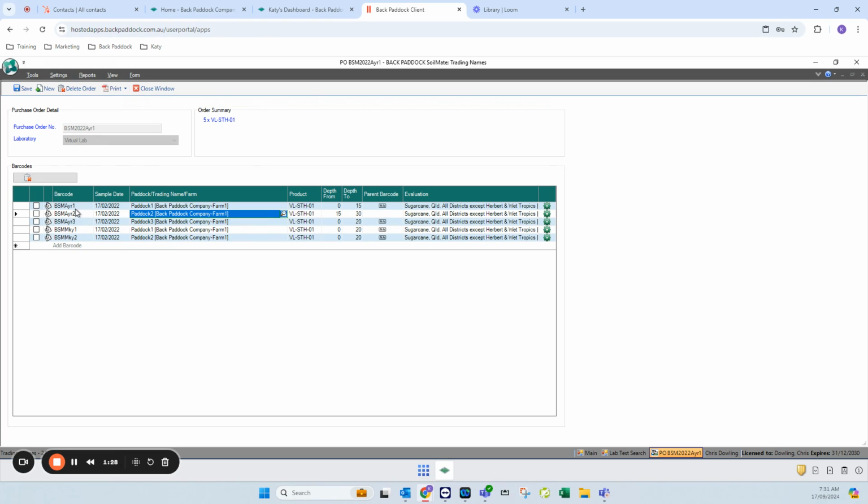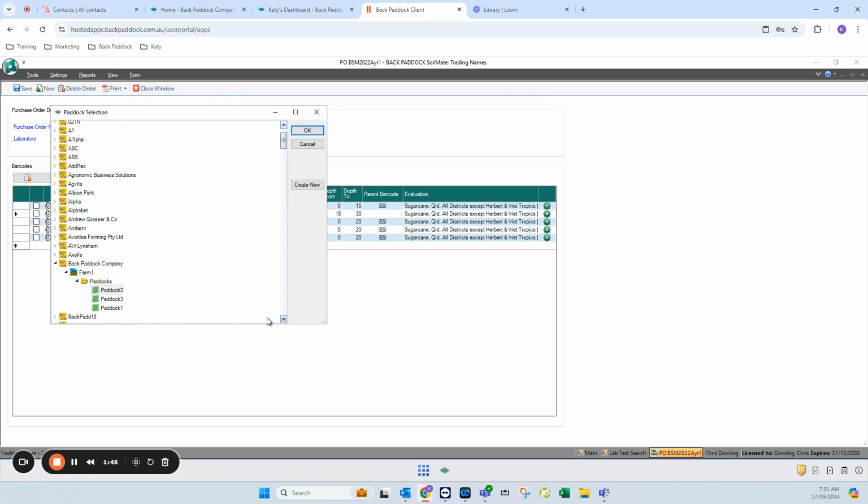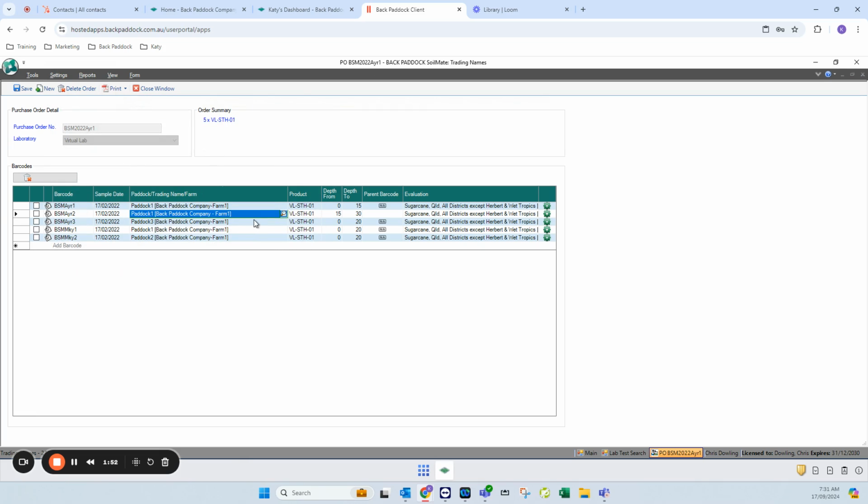So because I want Air 1 and Air 2 to be a profile, they both need to be assigned to the same paddock. So now we're going to go with scenario 2 and reassign this barcode, Air 2, to the same paddock as above. So I'm going to click in this field here, I'm going to click my magnifying glass, and I'm going to assign this one to paddock 1 instead of paddock 2 and click OK. So it's exactly the same method as you used when you first did that data entry to assign that barcode to that paddock, except we're doing it after our results have been received.